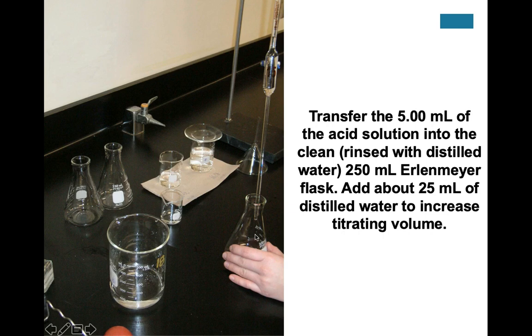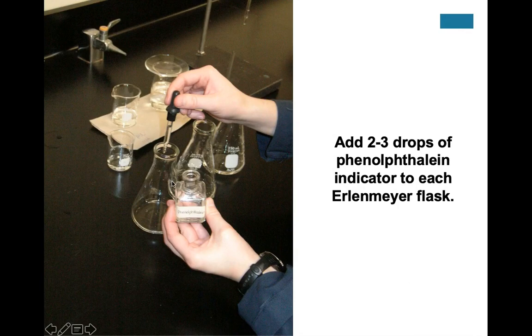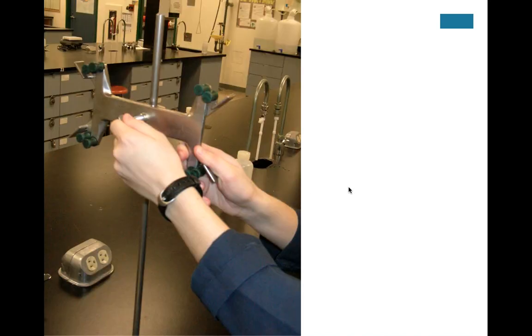It doesn't affect the amount of moles of acid because we already measured it from the volume that we dispense from the pipette. So at this point, remember, if we add the distilled water here to increase the titrating volume, it doesn't change the number of moles of acid that we dispensed from the pipette. So now we're going to add phenolphthalein in there. And so at this point, since the acid is in the Erlenmeyer flask, the color should be clear.